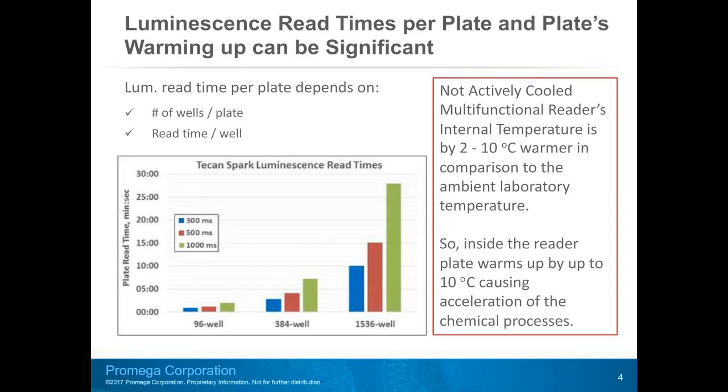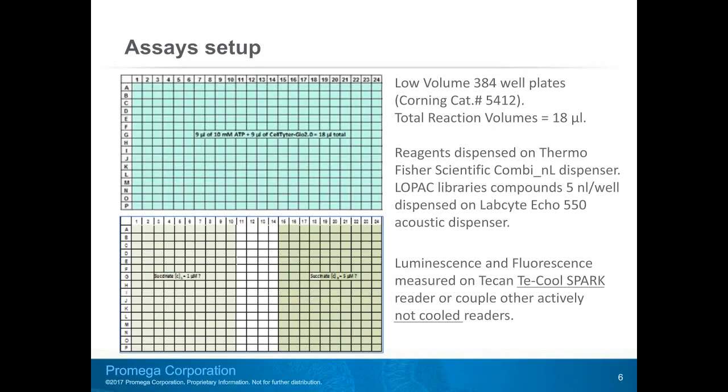Multi-well plate read time inside the reader depends on a couple of factors: the number of wells per plate and also signal acquisition time per well. As you see on the graph, the read time of the higher density plates is quite significant. The plate residence time inside the reader is sufficient to heat up the plate from 2 to 10 degrees Celsius depending on the reader. All the measurements I present today were assembled in 384 well plates with an acquisition time of 300 milliseconds per well. Based on these settings, the read time for one plate was just under 3 minutes.